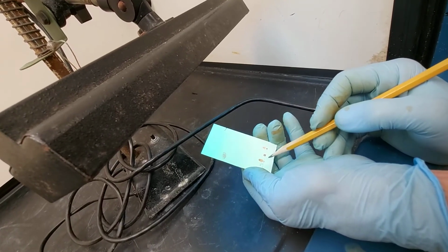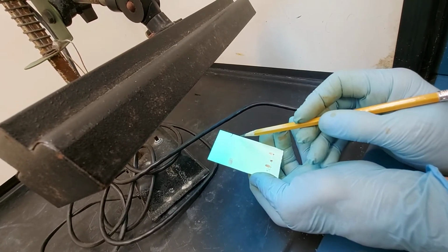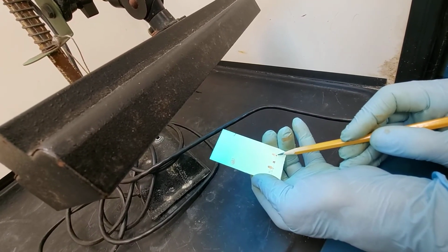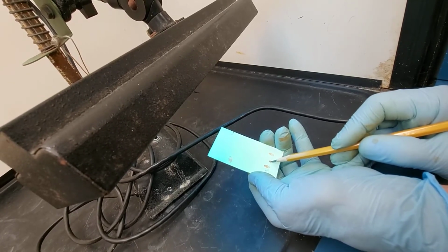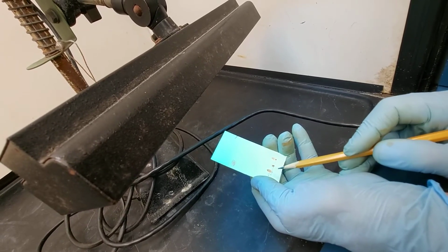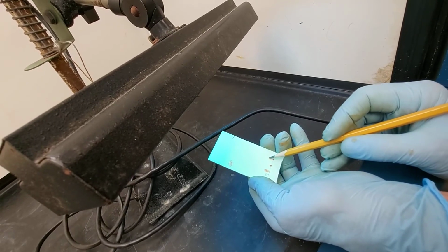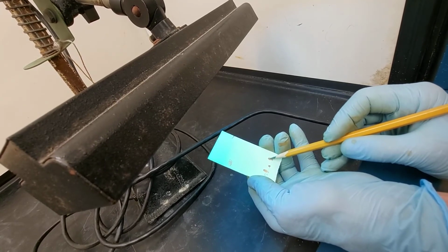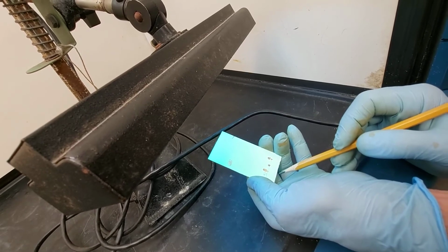Now, if you had to guess, in this sample, you would say, I don't see ferrocene. I see acetylferrocene and diacetyl. How do I know that's diacetyl? It moved to the same height as this one. How do I know this is acetylferrocene? It moved to the height of this one. On my exam, definitely this is a darker spot here than here. I would guess that acetylferrocene is the major chemical in that mixture. And I would write that down for 3 points on my final.